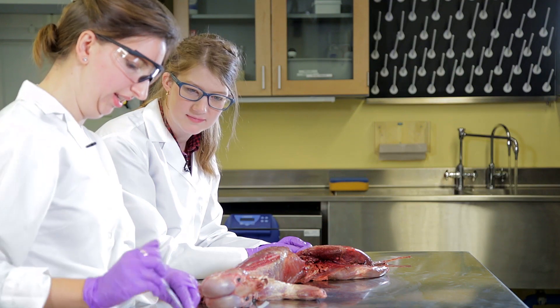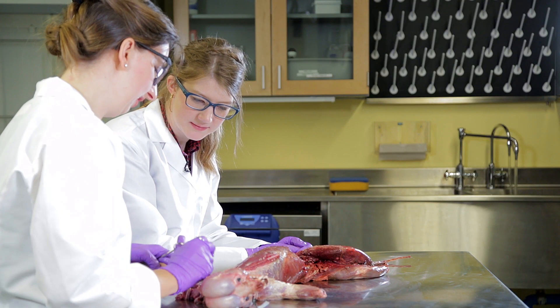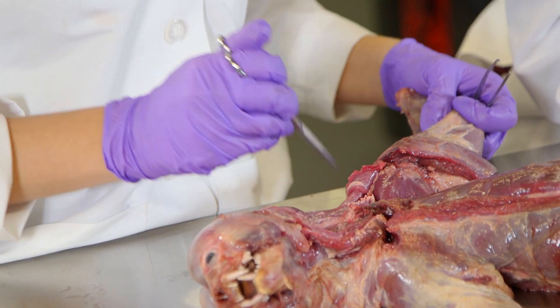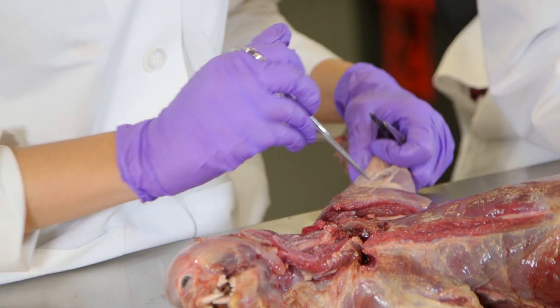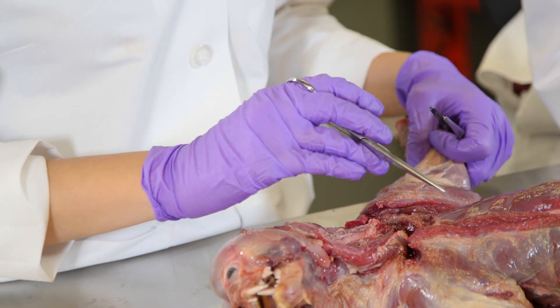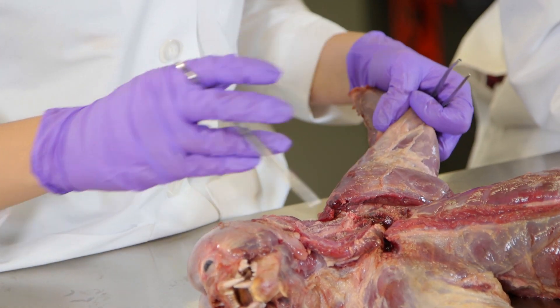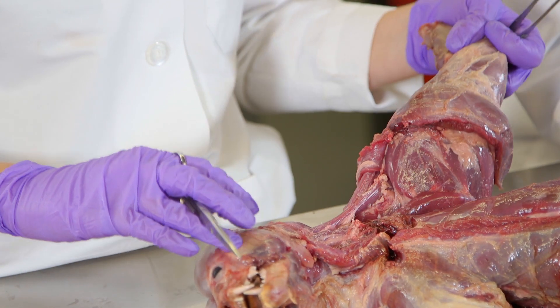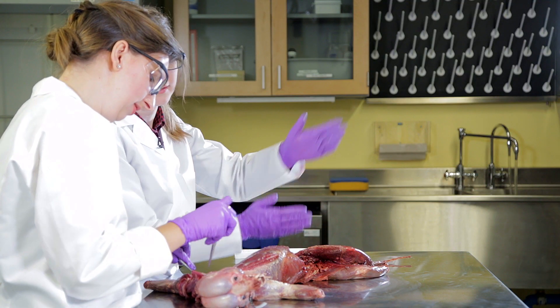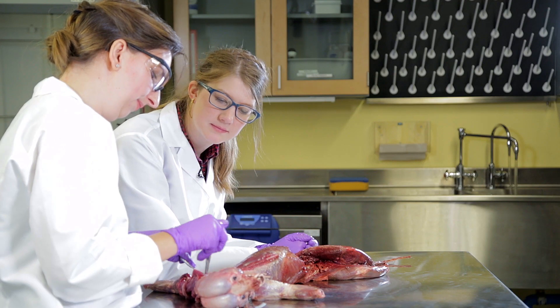Notice how I'm dissecting a lot with my scissors? Even though it's called dissect, ideally you just want to split tissues along their natural planes more than actually cutting through tissues — you're just separating things.